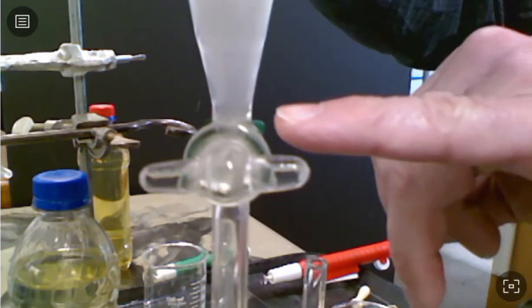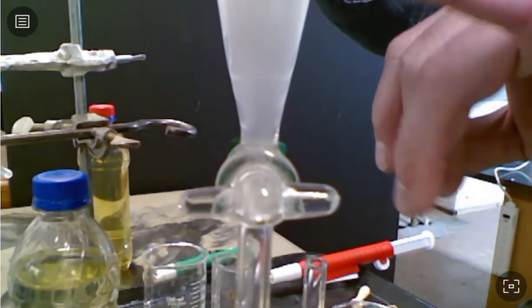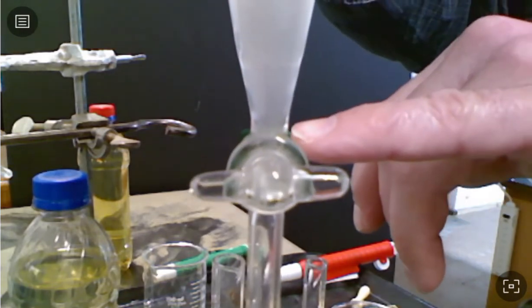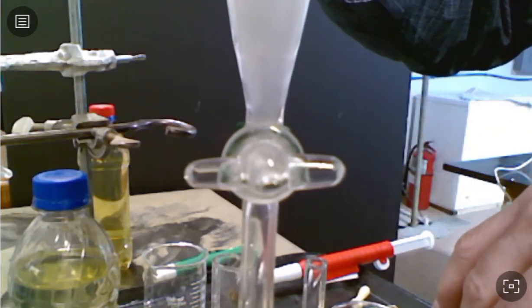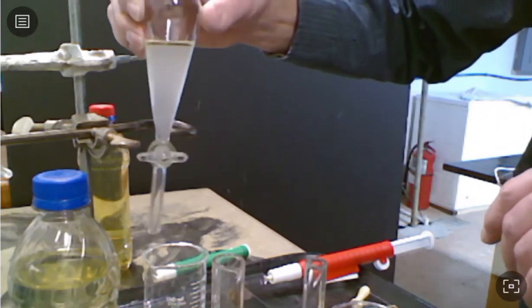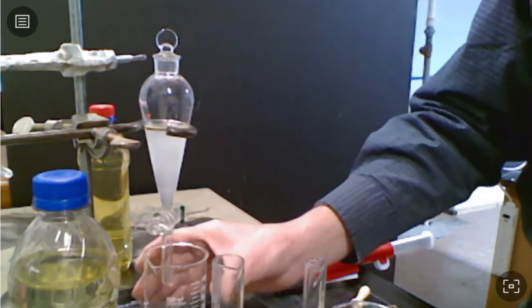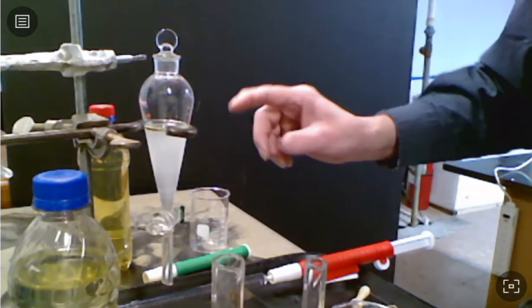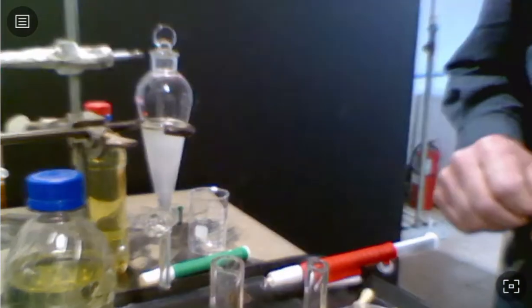And I don't have any perfectly clear layer down here. A lot of times if you just let it sit long enough, all of this will clear up and it will look just like water again and clear, but we're going to kind of run out of time before we accomplish that. So we're going to go ahead and proceed with our lab. All right, I'm going to put this back in there, and then we are going to pull off the water layer, obviously first, because it's the lower layer, and then we'll pull off the upper layer.